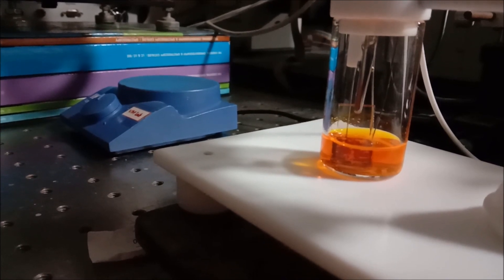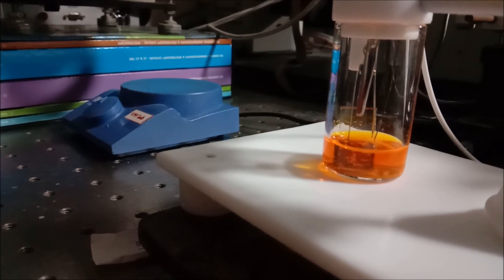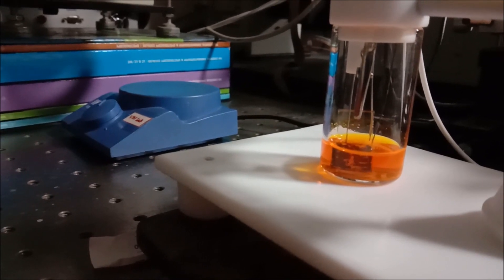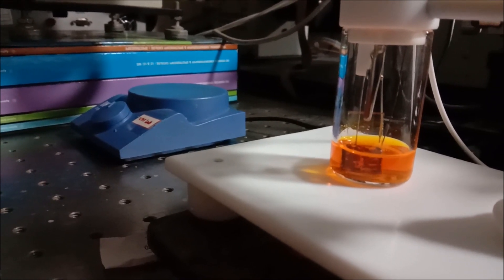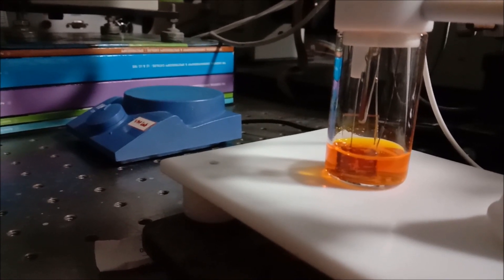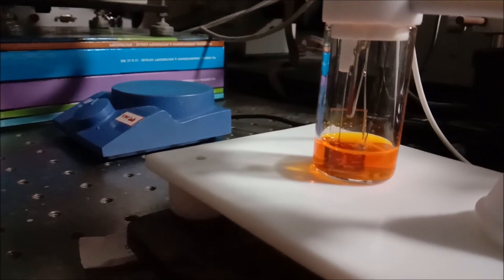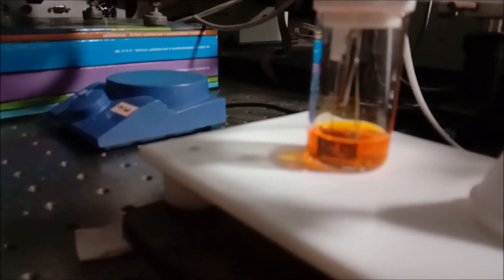Now you can see the darkness has increased. Now the darkness is fading away. We are doing this electropolymerization on FTO substrate using CH instrument.